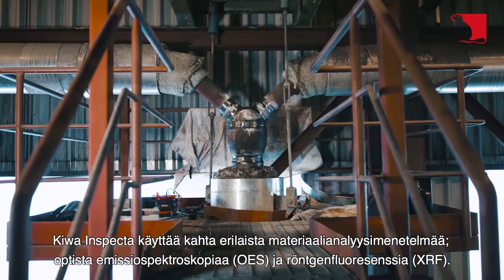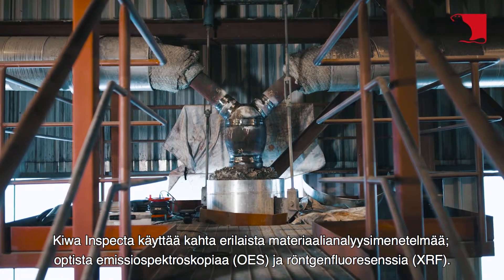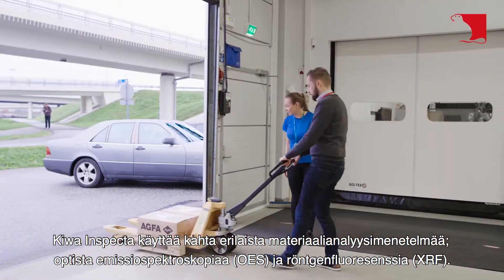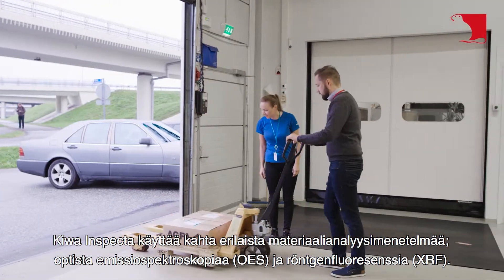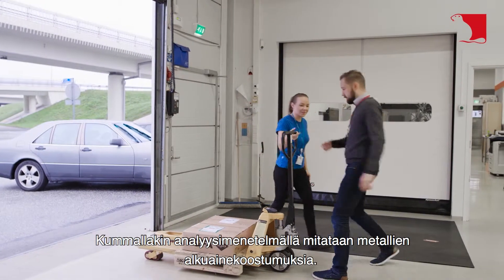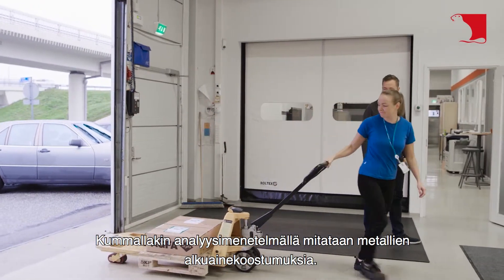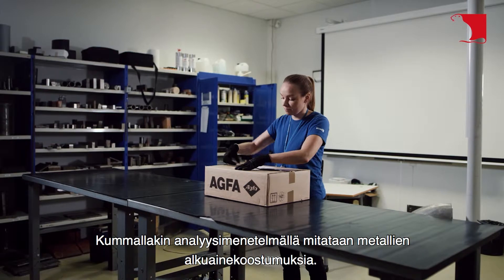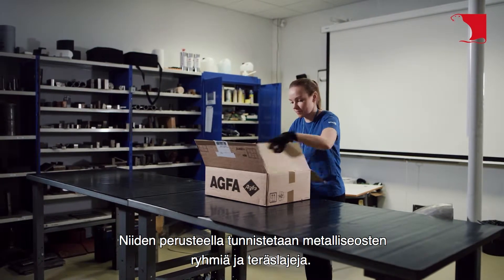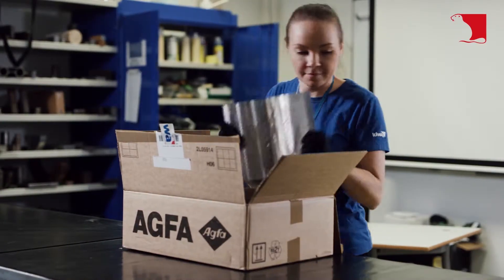Kiwa INSPECTA uses two different methods of material analysis: optical emission spectroscopy and X-ray fluorescence. Both analysis methods measure the element composition of metals, and alloy groups and types of steel are identified based on them.